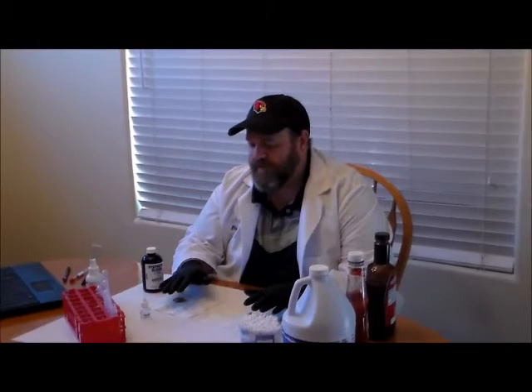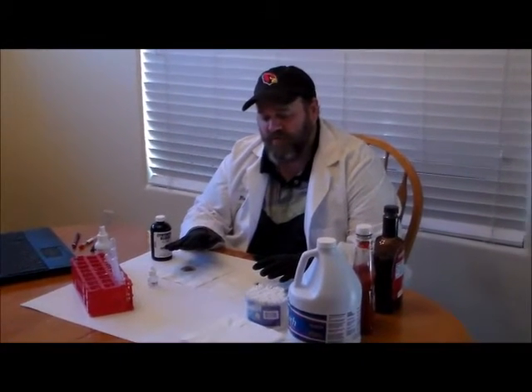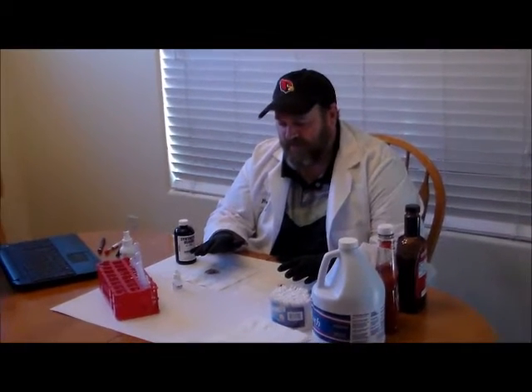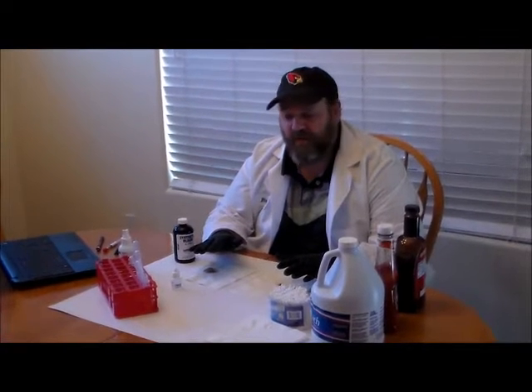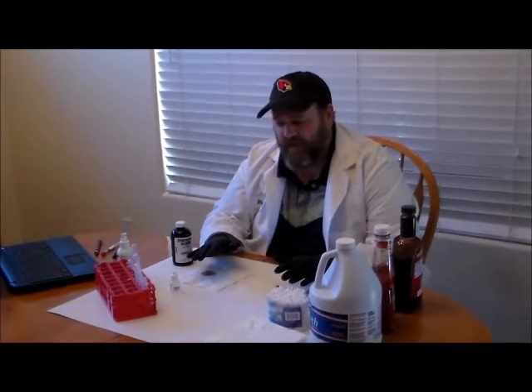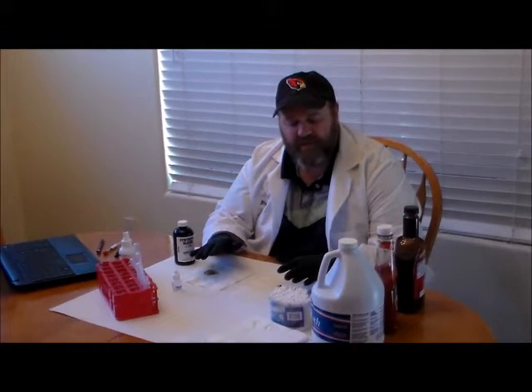We're going to be testing using two different reagents that are used as presumptive tests to try to identify blood stains, and then we have one reagent that's used in an effort to try to identify semen stains. Now it's important to remember that these tests are presumptive tests — they are not confirmatory. They don't positively identify the presence of the fluid because there are some substances which can give false positives.